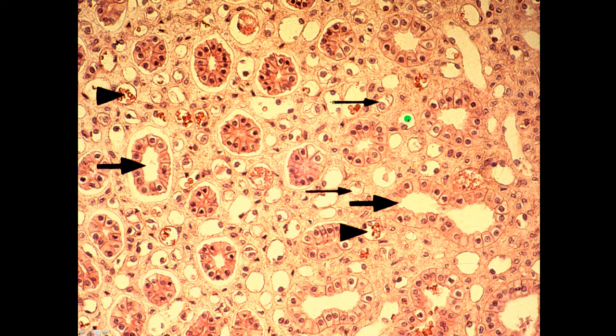Thin limbs of Henle's loop shown here or here, maybe at these thin arrows, some thin limbs of Henle's loop, and then profiles of vasa recta shown here at the thick arrow heads. And you clearly know these are vasa recta because you can see red blood cells in the lumen. Otherwise, as you were to look at the deep parts of the medulla and you look at thin limbs versus vasa recta, it's very difficult to distinguish thin limbs from vasa recta, except for the fact that the lumens of the vasa recta will have red cells present, whereas the thin limbs obviously don't have red cells. And I don't see any thick limb profiles here because I'm very deep in the medulla.